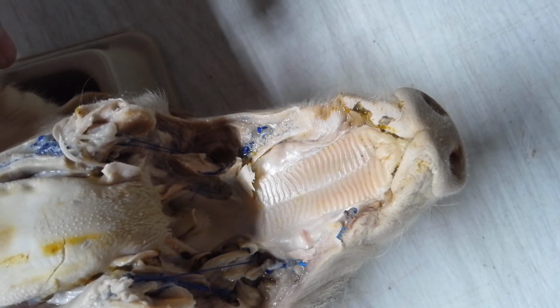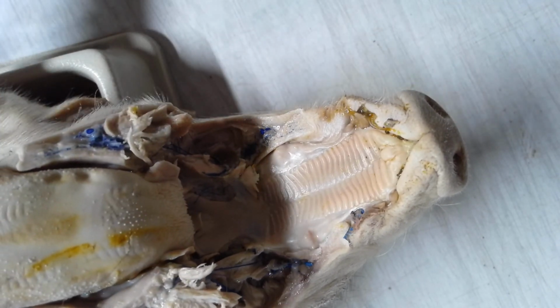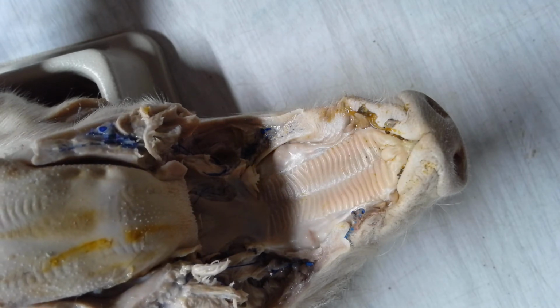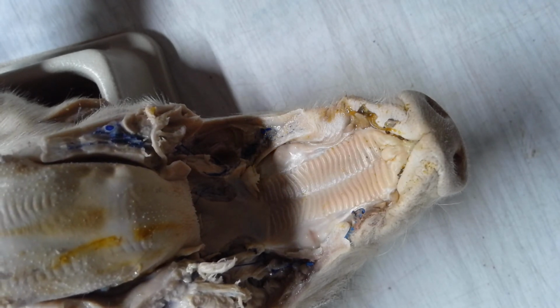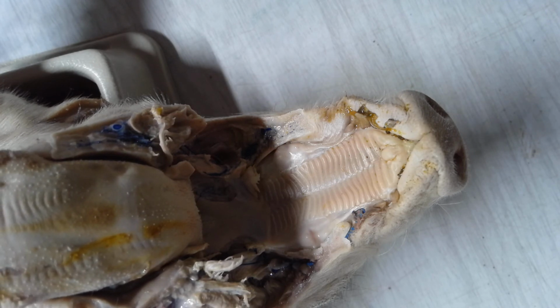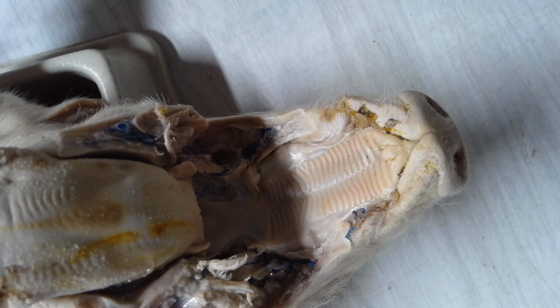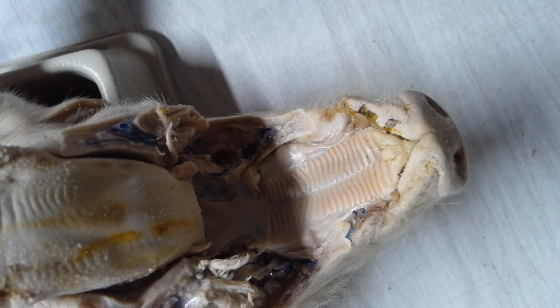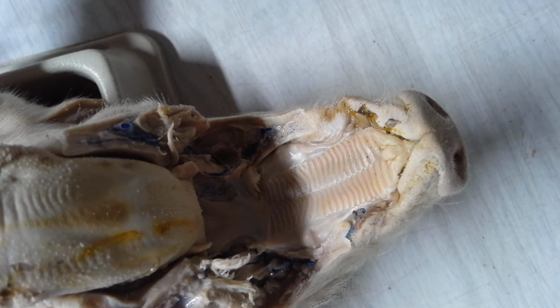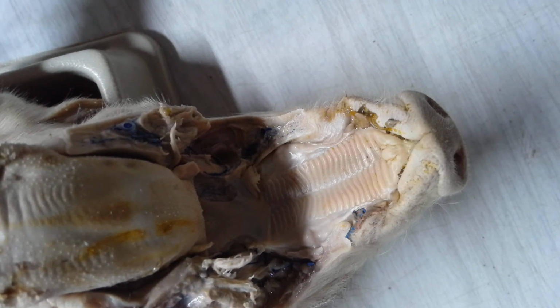Okay, this is Human Biology 104, the Fetal Pig Lab, and in this video I will be going over the structures for both the Fetal Pig 1 and the Fetal Pig 2 lab. I will be starting off in Fetal Pig 1, working with the mouth area, and then going down into the neck area and the chest, and then going down into the lower abdominal area for the last part of the video.